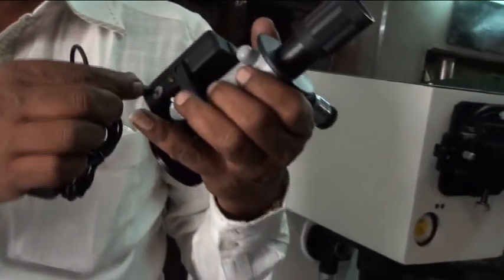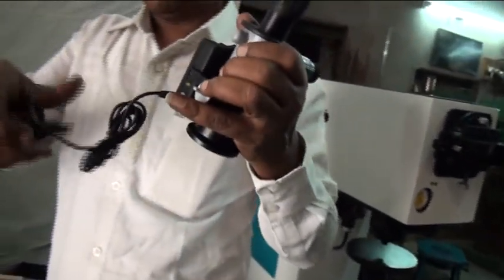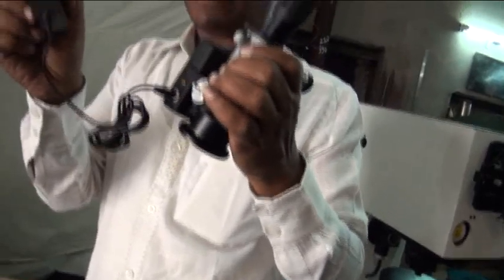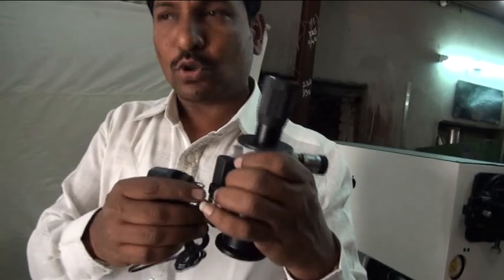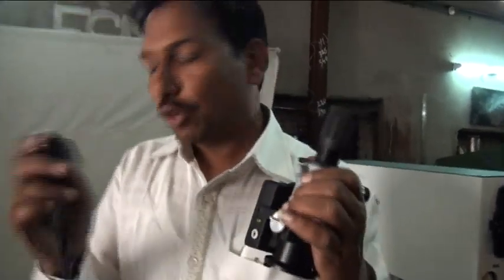There is a battery. But if your battery charging is no, then you fix this point here and go to single phase connection and charge the battery. The battery is now charged. So I will remove this one.